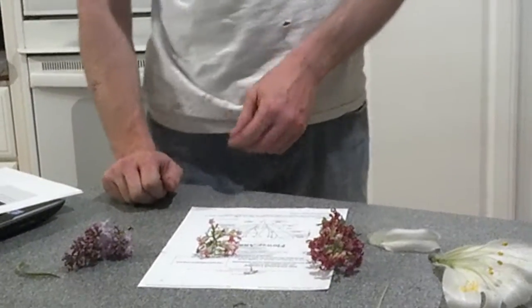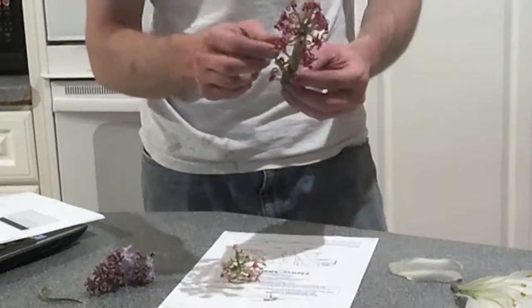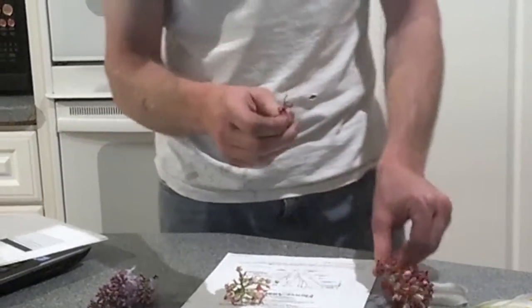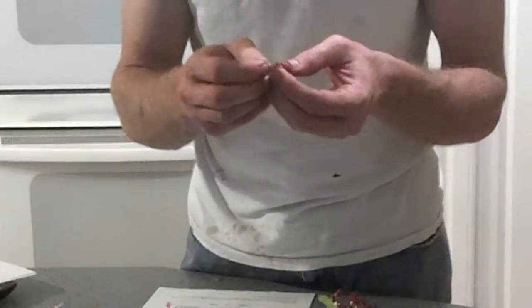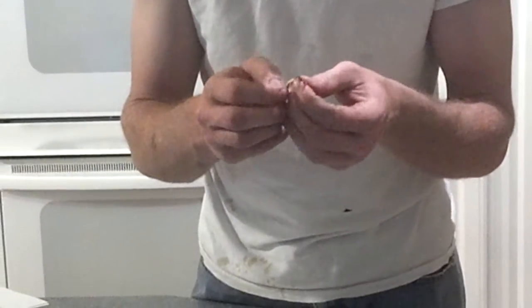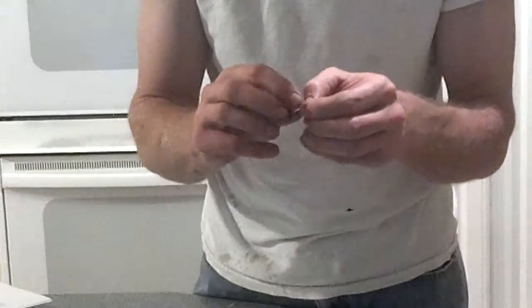So I believe that pretty much wraps up the dissection of the flowers. We can do this on each. This one here on the hyacinth, actually, if we go look at the ovary, this is probably in the latest stage of development of these plants.